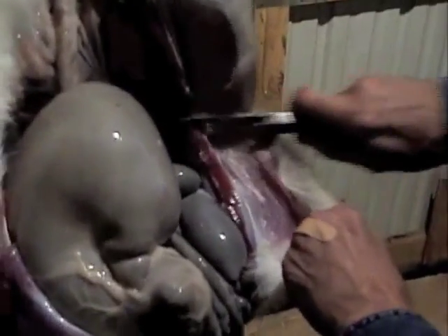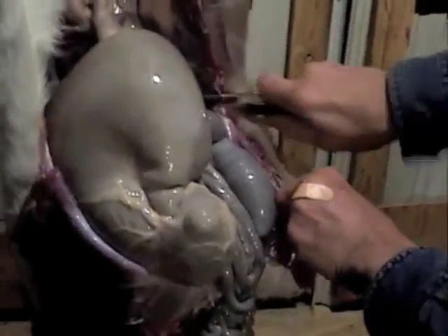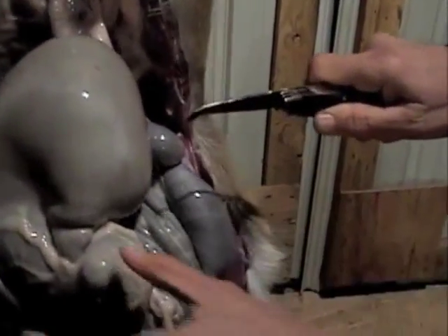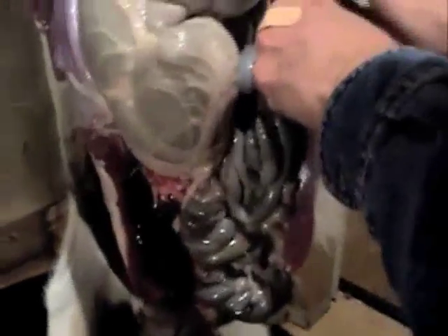What he's cutting through now is the abdominal muscle — that's your six pack. This thing right here is the stomach, all this down to here. This right here is the small intestine — look how long it actually is.